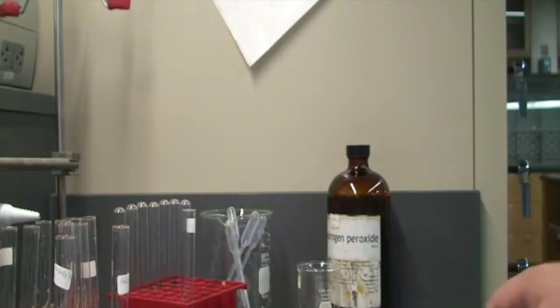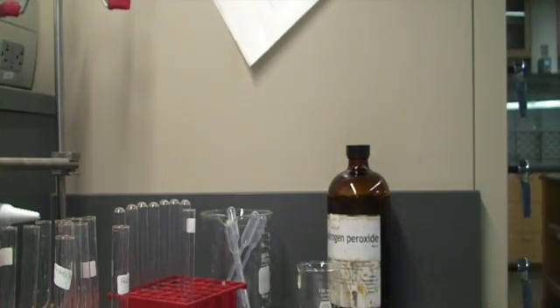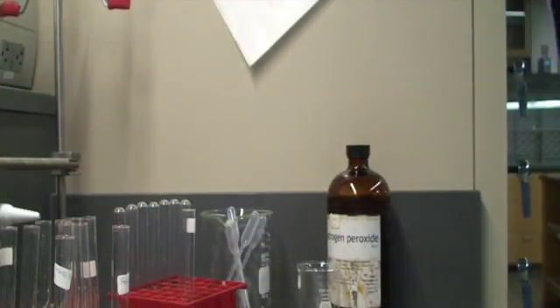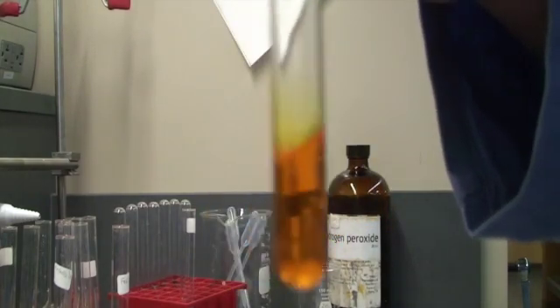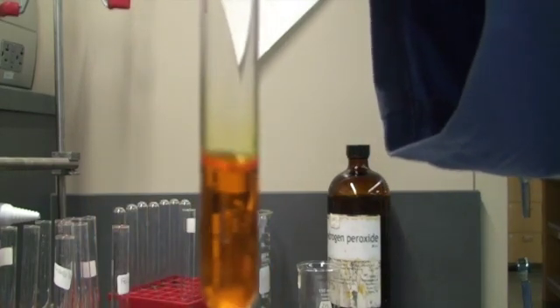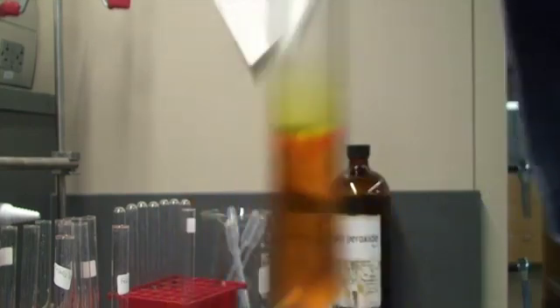Let's move on. The next thing we're going to do is — we have two samples here of potassium dichromate. Potassium dichromate has chromium in the +6 oxidation state, and it's a nice orange color.